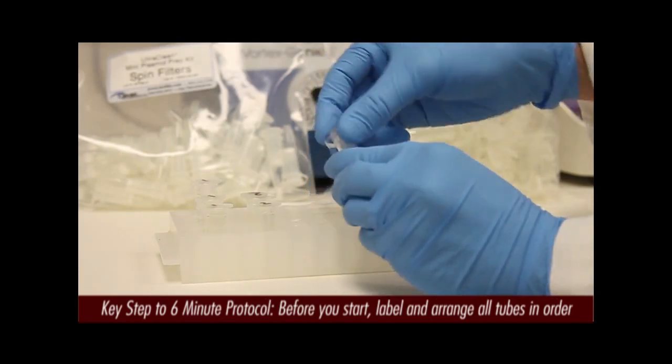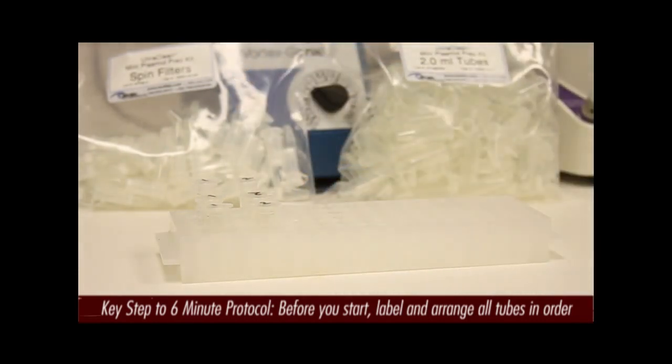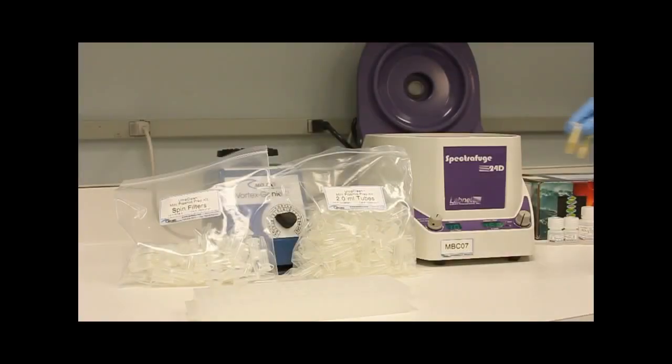If you are using the 6-Minute Kit, prepare up to 2 mLs of culture. For the Standard Plasmid Kit, prepare up to 5 mLs of culture.